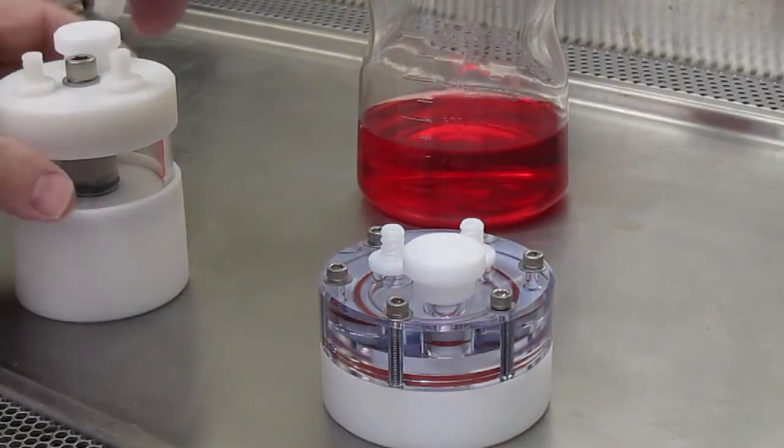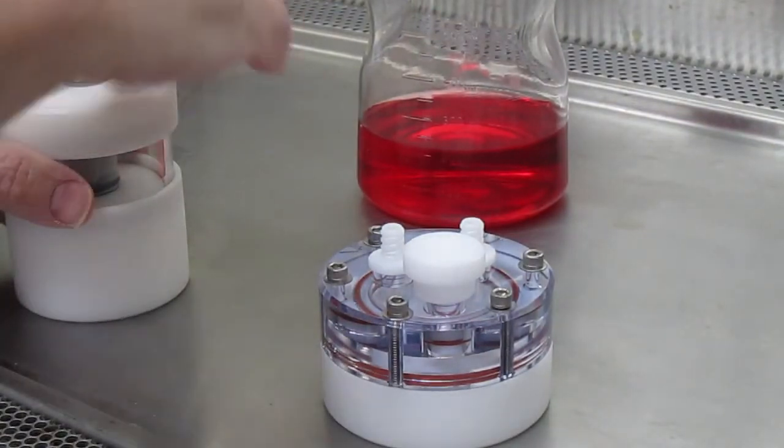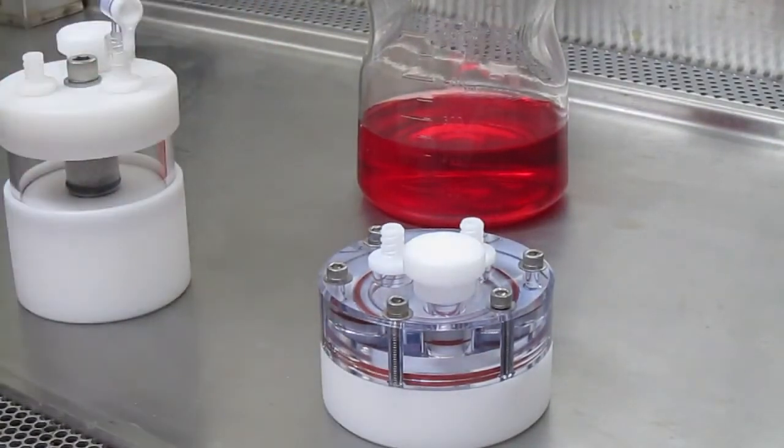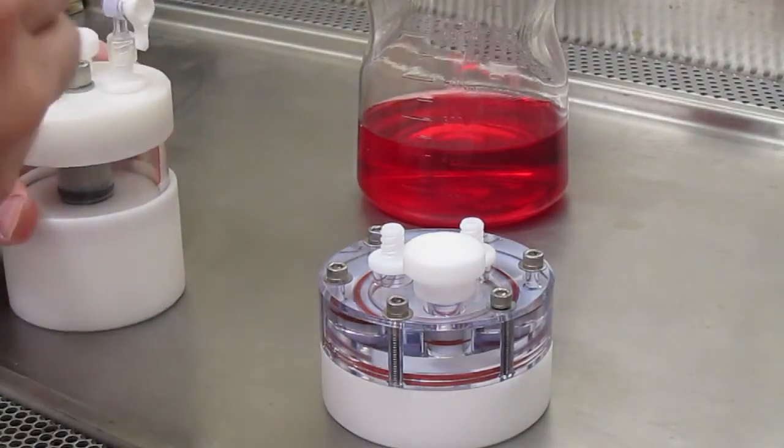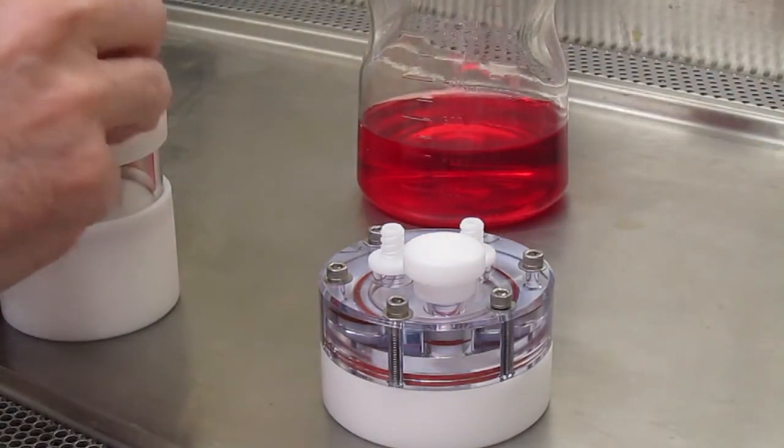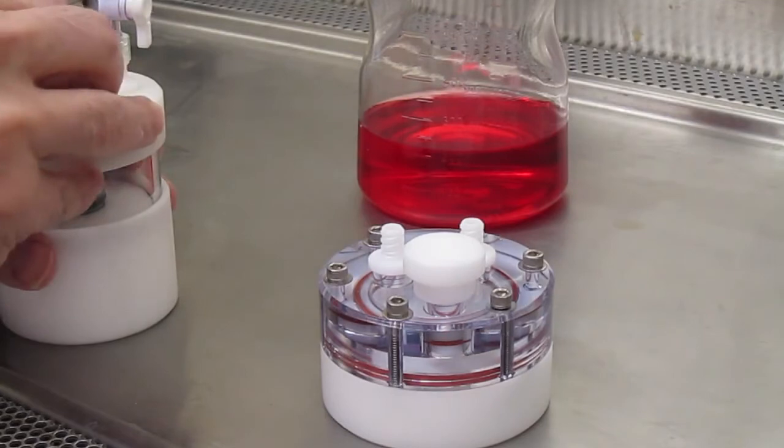Then, disposable valves are placed on the ports. These come individually packaged and sterile and are discarded after each experiment.